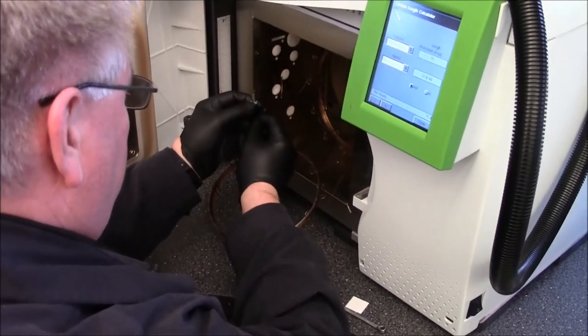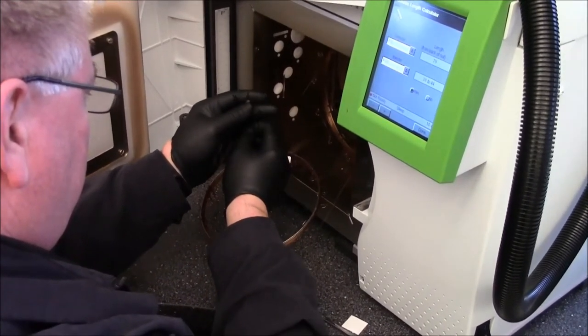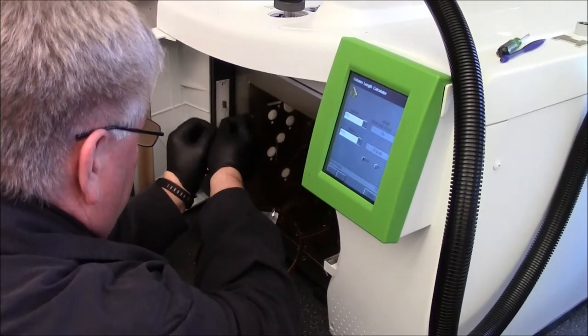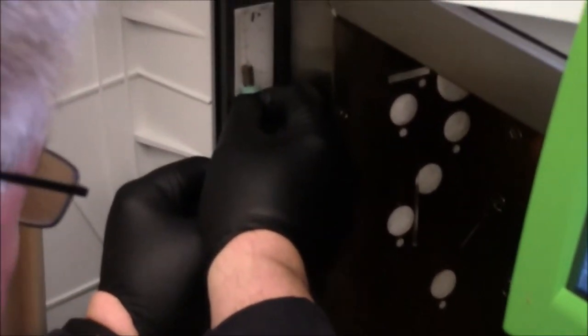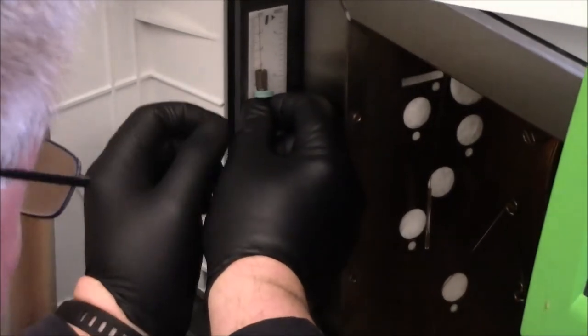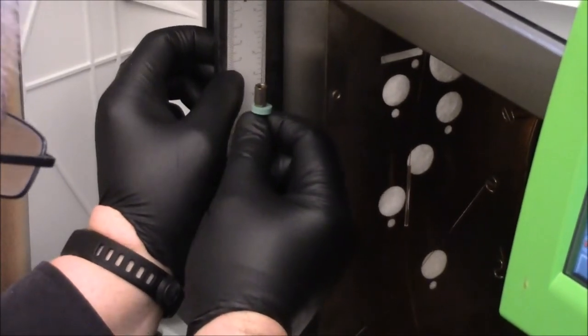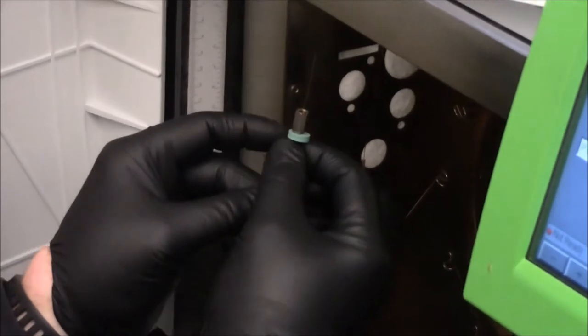What you do is you take and measure from the back of the nut, you want about 38 to 44. So if you put it right around here, then just pull it down until the top of the column is right there at the beginning line. And you're somewhere between 44 and 38. And then the septum actually helps hold it at the right length.